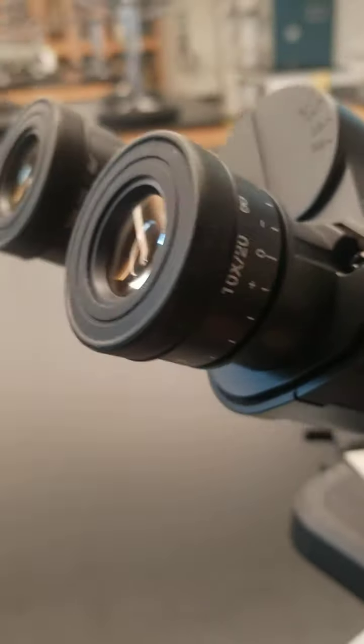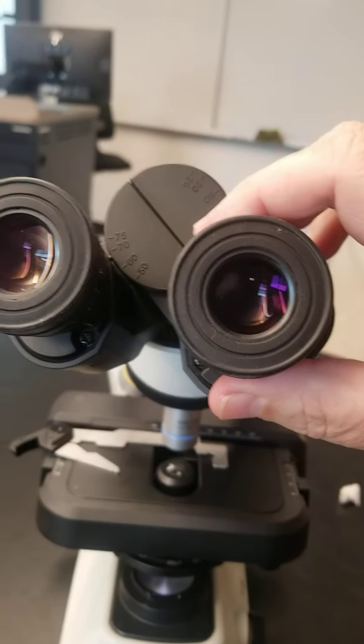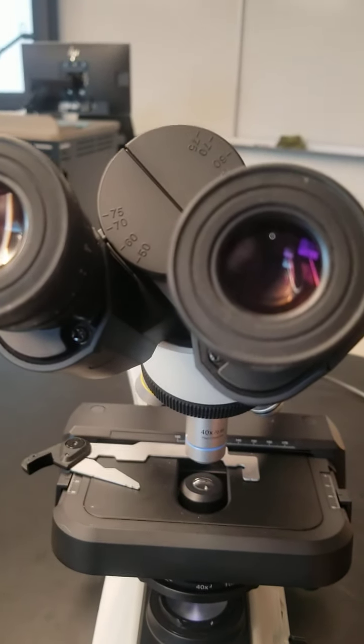That structure that you put your eye up next to, that's called an objective, and then we have an objective lens right inside there as well. The two things here are referred to as, I'm sorry, it's an ocular.